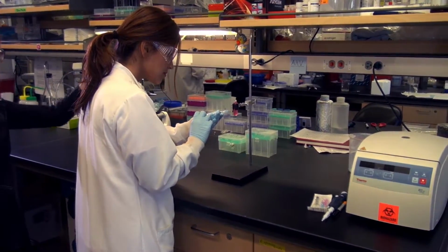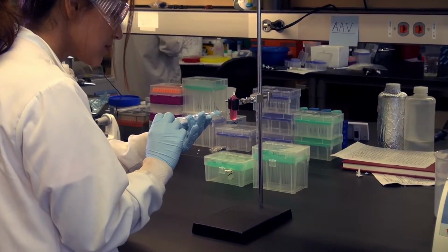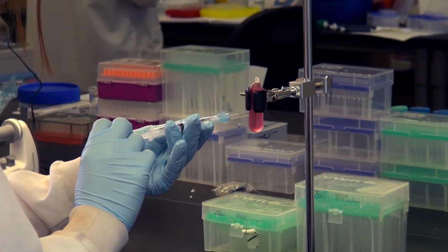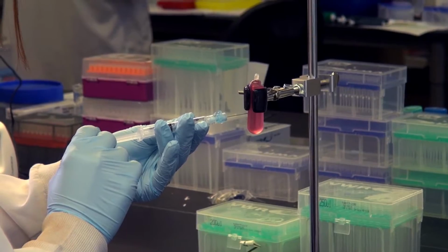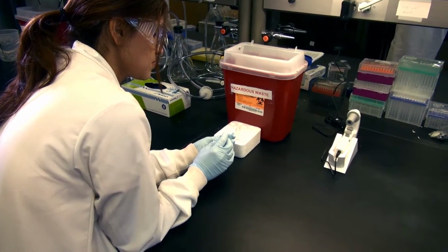She is using a holder to extract the virus from a plastic centrifuge tube. This is very important because if she were to hold the plastic tube in her hands, the needle could go through both sides or slip off the side. Another option is to use a tube rack placed against a wall or column for stability.